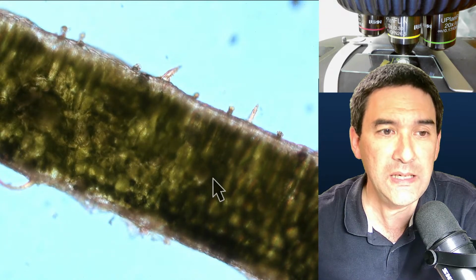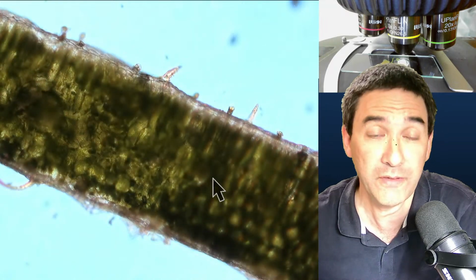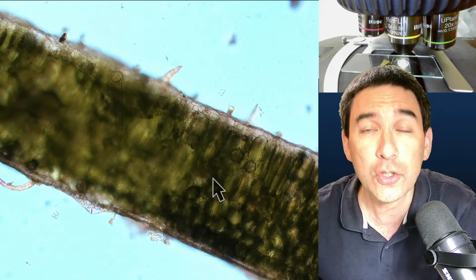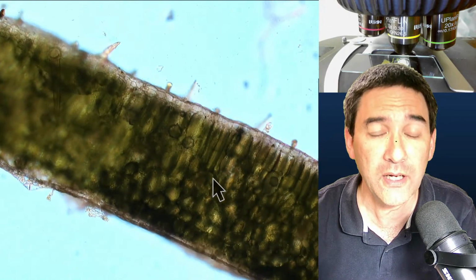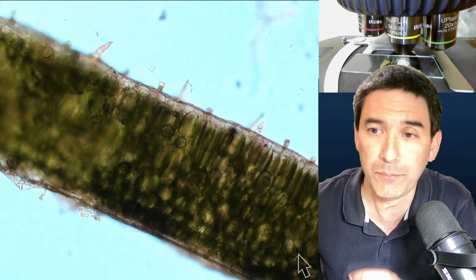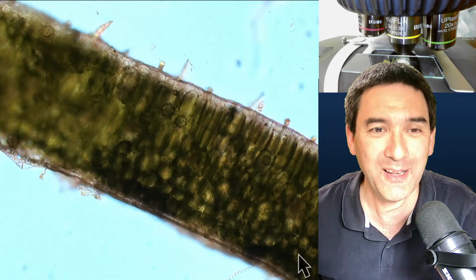Those spikes on the leaves of this plant are quite common, and they have various functions, but especially if you find them on the lower surface of the leaf, then sometimes they are there to actually decrease the loss of water vapor. So over the stomates, they can sometimes be found to kind of shield the openings of the leaf to prevent loss of too much water. Just one possible example. So those little sticks, okay, I'll not answer the questions now. I'll wait for later on.